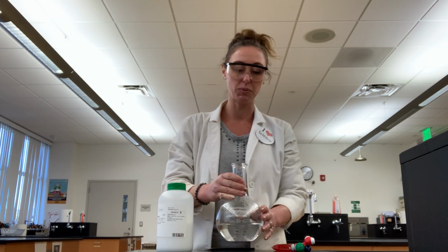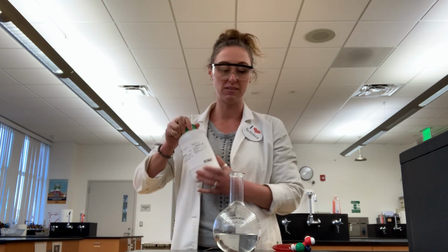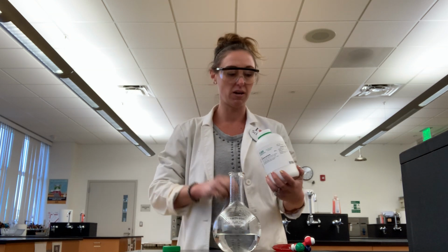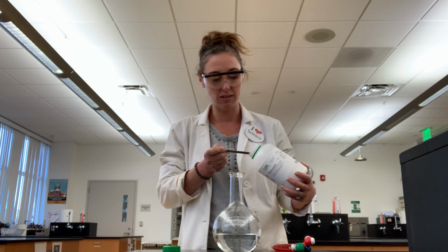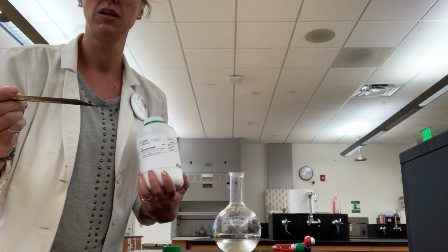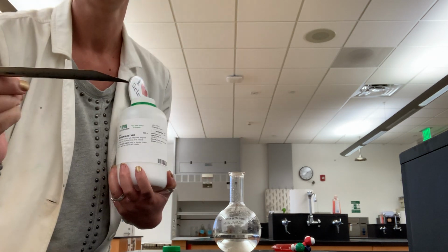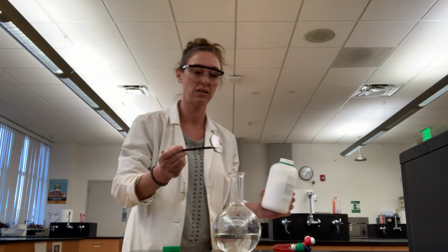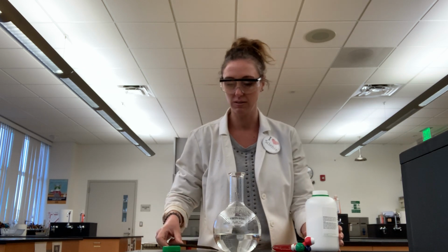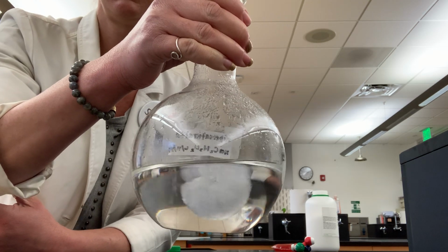And the way I can prove this to you is I can actually shock it back into its solid phase by simply adding a single crystal of sodium acetate. What I'm doing is agitating the solution just enough to make it turn back into a solid. So if you can see here, I just have a single crystal on my spatula, a tiny, tiny amount. And I'm going to go ahead and just add this into my container. And I'm going to hold this closer so you can see what's happening.